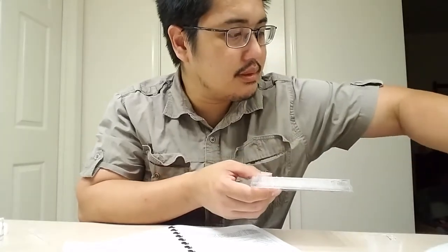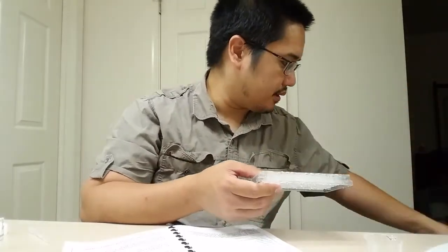To be honest with you, this experiment is a bear to set up. Alright, this experiment is a real beast to set up. But you understand how to do it, and so basically it's just a matter of time before you're able to finish the whole experiment. Do the cleanup, do the lab, answer the questions, do the lab report. I'd recommend highly that you take lots of pictures of this particular experiment, and that way you can get a nice good record of what you did and include those pictures in your lab report.